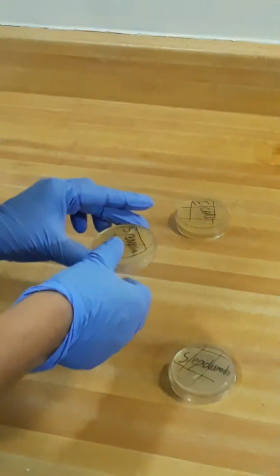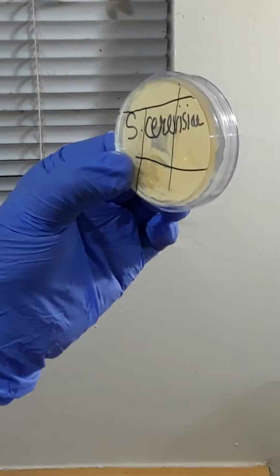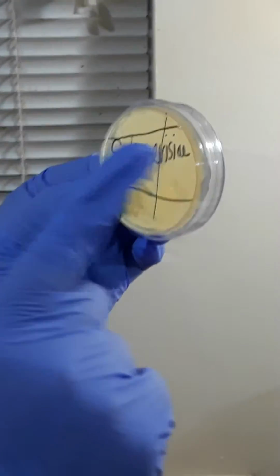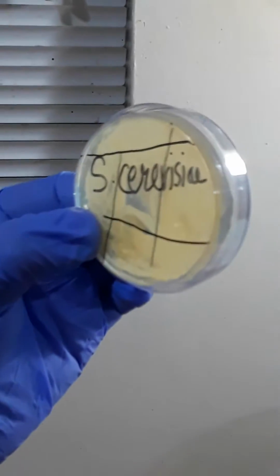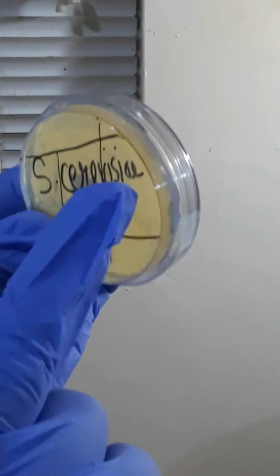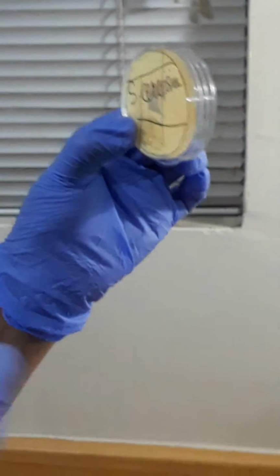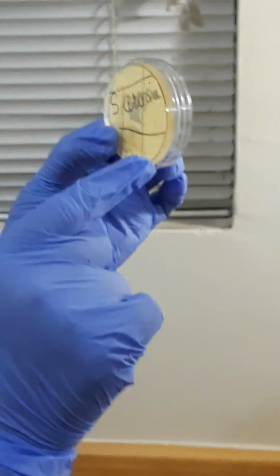So that's the characteristic of E. coli bacteria. And the second one is the yeast. You can see I did the same thing again. I repeated it. That's why I see overcrowded colonies here. And these are also off-white. I can see the whole pattern, and it's a pure culture of yeast because I don't see any different color in them.